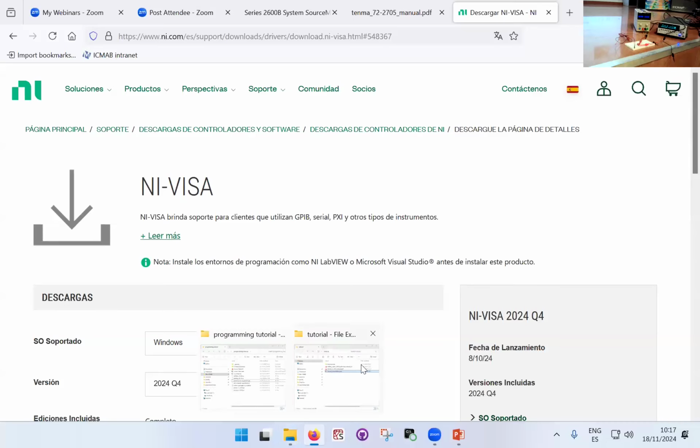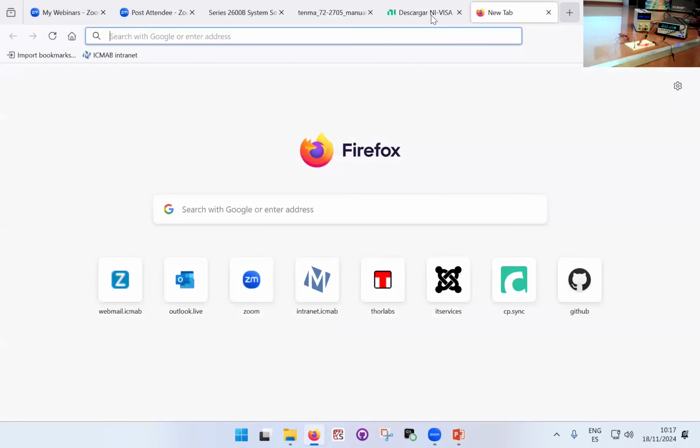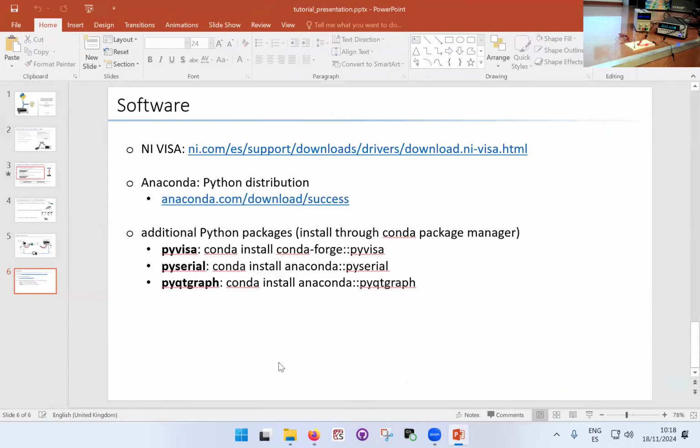So once you download that, you install it. That's one part of the software story. Then you have the Anaconda Python. Anaconda is just a Python distribution. You can install Python on a computer in many different ways. This is a very common distribution in science, generally speaking, because it includes a lot of packages that we as scientists use quite often. And this you will find on the Anaconda webpage. Here you just download it. This is all completely free. You don't need an account to actually download it. So these are the two things that you need in terms of the software.